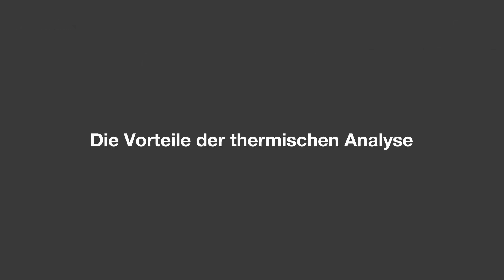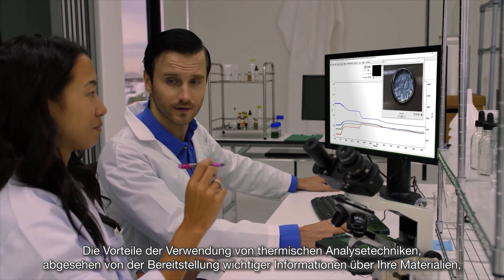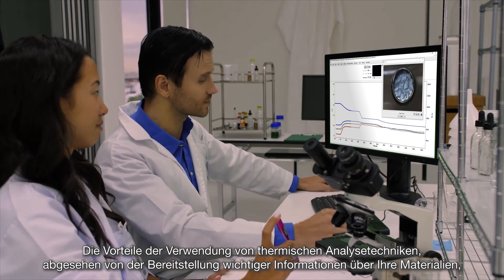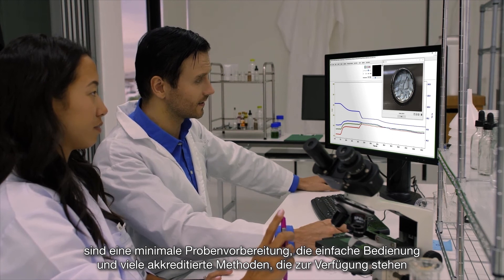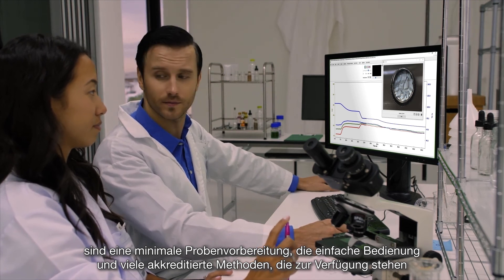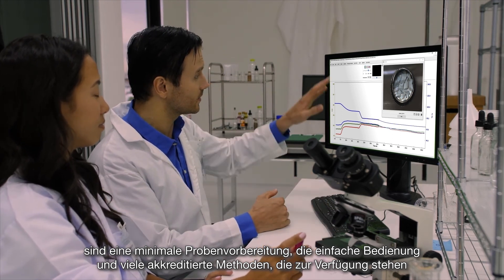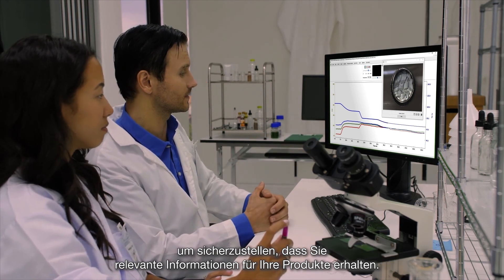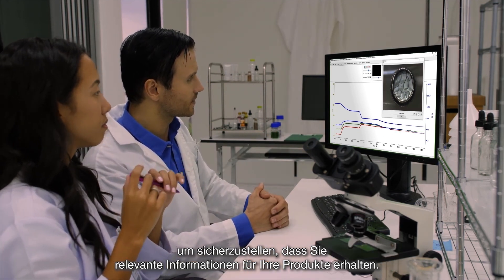The main advantages of using thermal analysis techniques — other than giving you crucial information on your materials — are that there is only minimal sample preparation needed, they are easy to use, and plenty of accredited methods are available to make sure you get relevant information for your product.